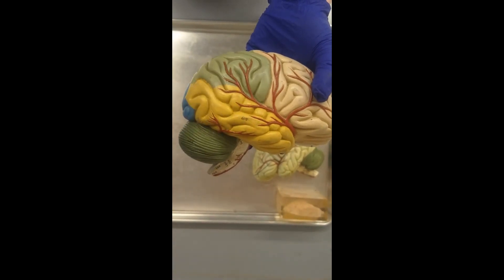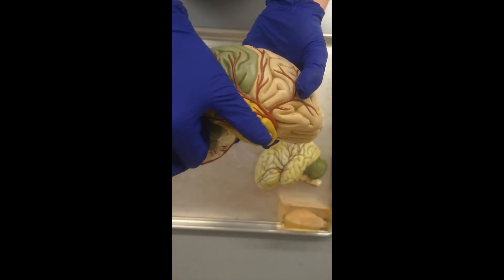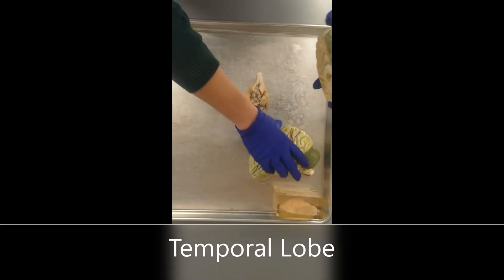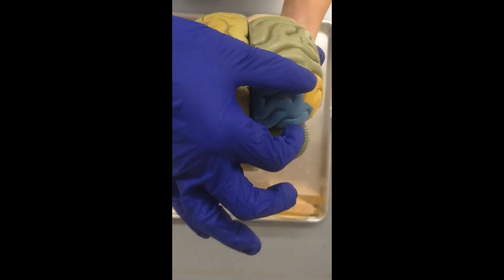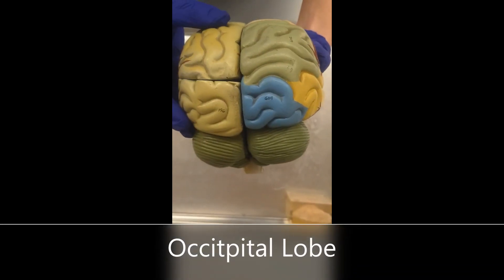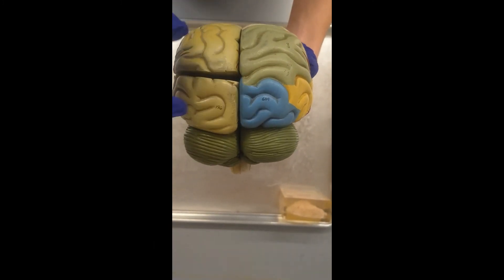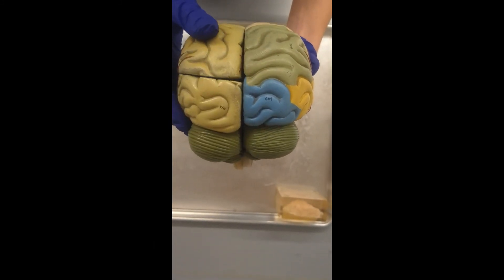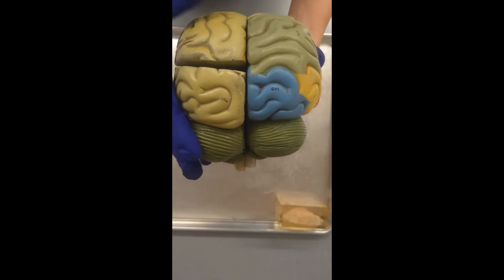The ear is associated with the temporal lobe, so a lot of auditory and speech processing goes on in the temporal lobe. And in the back is going to be the occipital lobe — like 'ocular.' So what information is going to be processed in that region of the brain? It's probably going to be vision and sight.